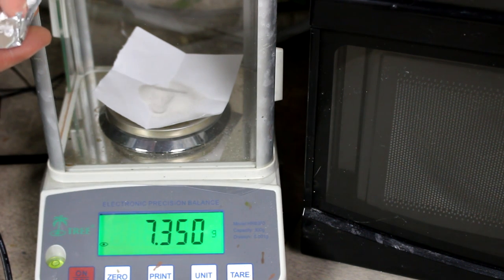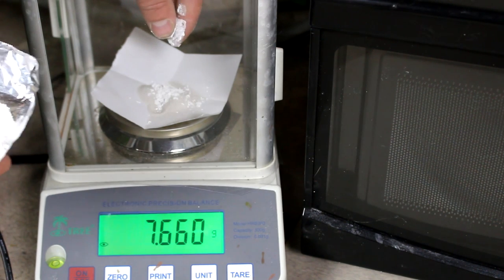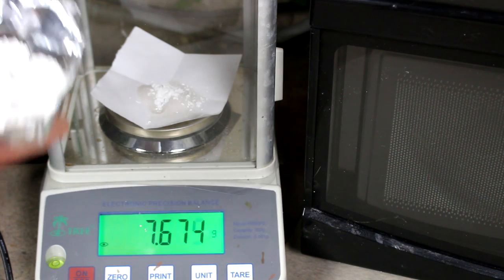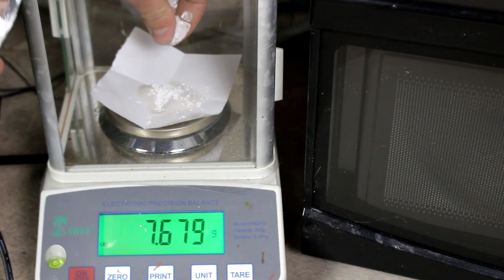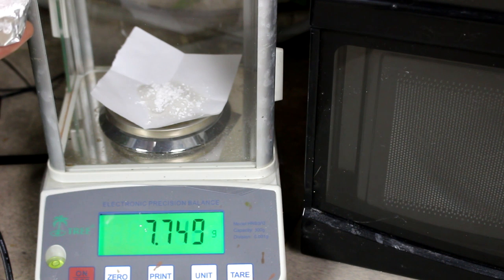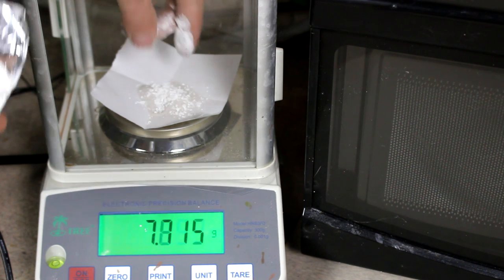Now I'm going to need approximately one gram of calcium carbonate. This very fine calcium carbonate powder, by the way, is actually chalk. Not the sidewalk chalk, this is actually the chalk that is formed by animal remains settling out of the ocean. You know, microscopic shells and stuff.